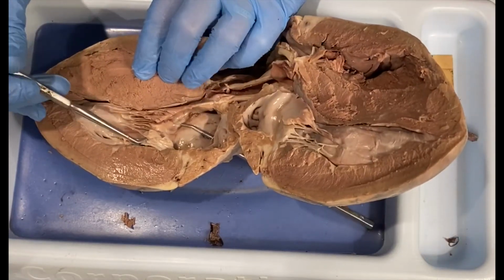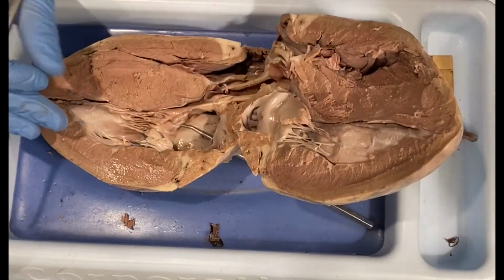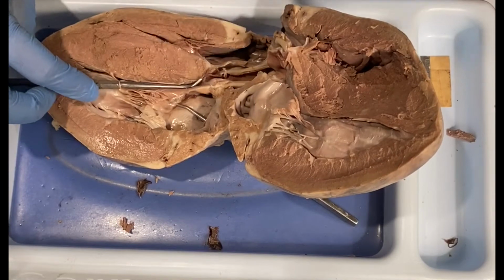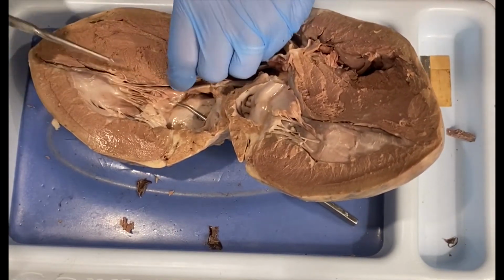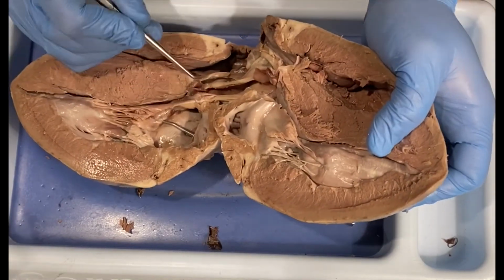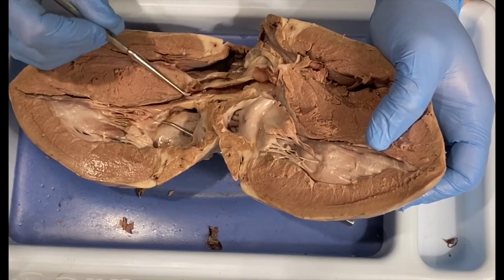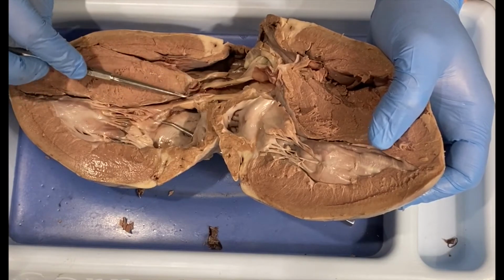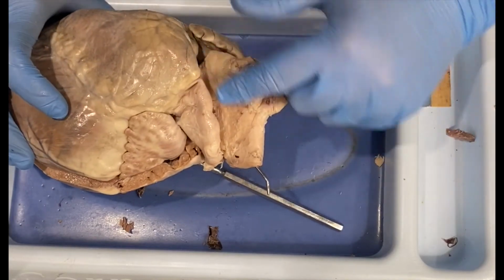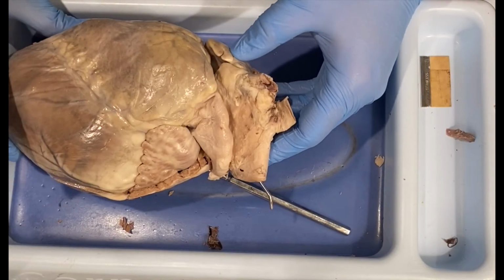So once the blood comes into the left ventricle, the pressure is going to build, the valve prevents backflow, and then that blood is going to pump through this region here all the way up, and I've cut through it, but this little flap right here, that was the semilunar valve that goes into the aorta. This would be the aortic semilunar valve, and the blood would travel into the aorta and out the different vessels depending on where the blood is actually going.